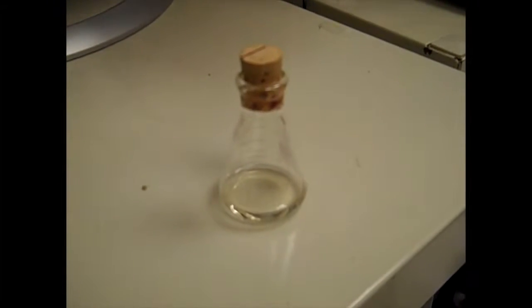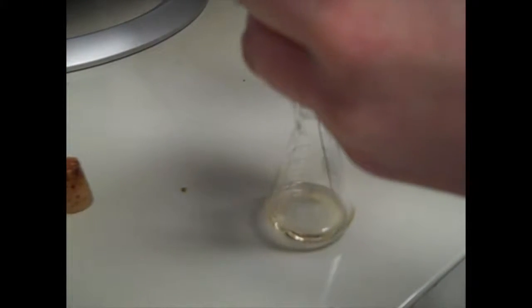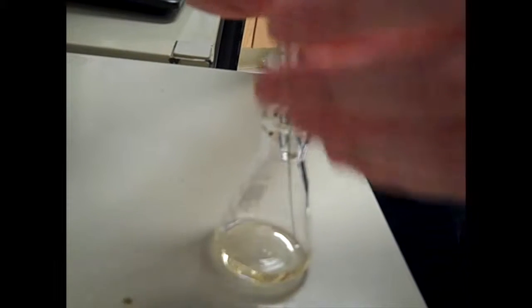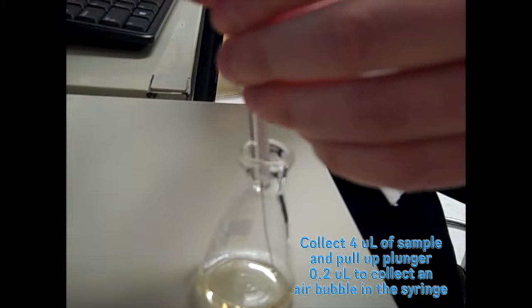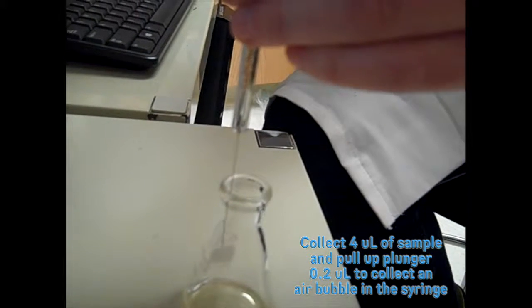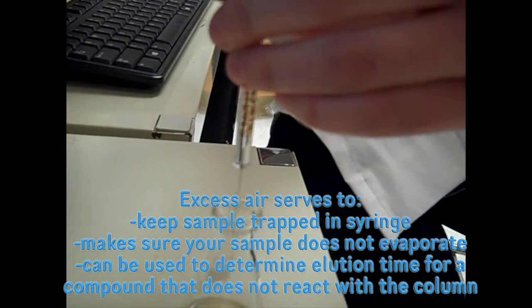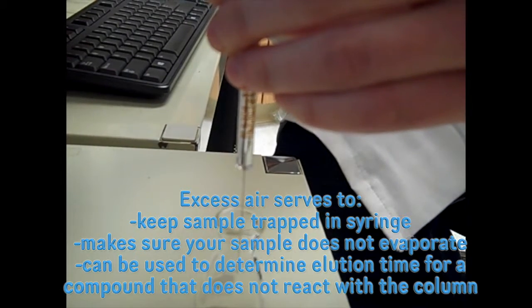Now for loading your sample into your syringe, shake up your flask with your mixture. Insert the syringe into your flask, pumping several times and only pulling out the syringe arm about 1 inch to clear out air bubbles. Collect 4 microliters of sample and pull up about 0.2 microliters to get a small amount of air in the syringe. This excess air serves to keep your sample trapped in the syringe so that it does not evaporate before you inject it.